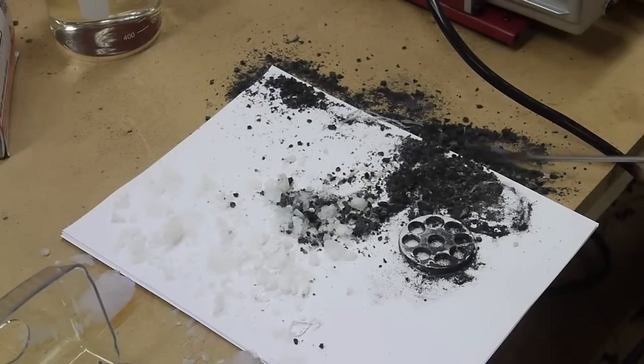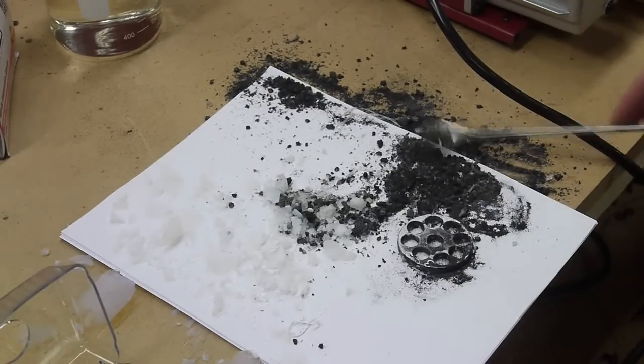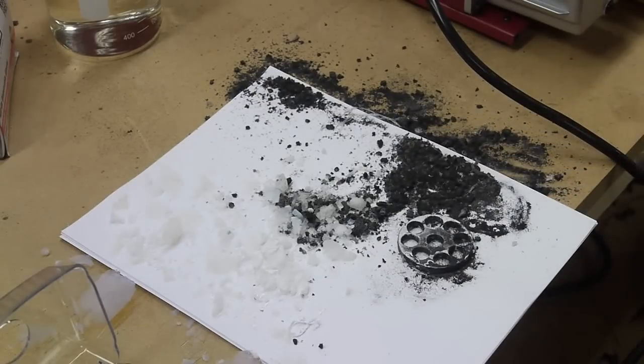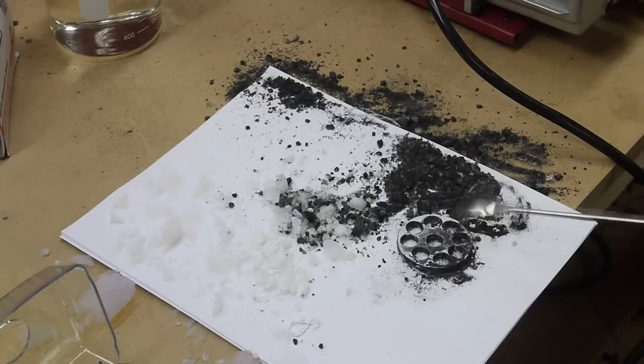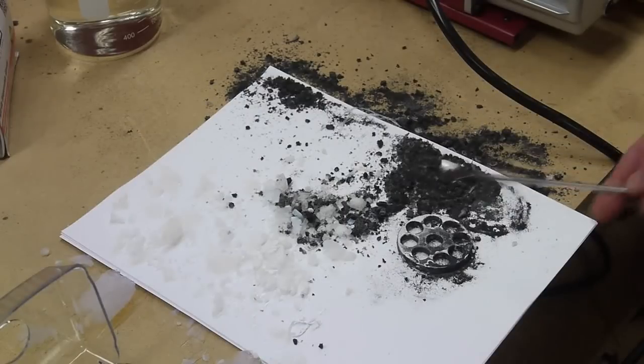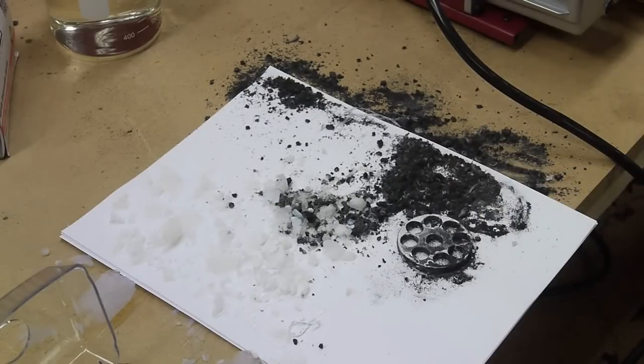So I don't know what happened there, but I'd be interested to know if you guys have some knowledge about how supercritical methanol reacts with aluminum. It looks like it just burned away, although I don't know the chemistry involved.